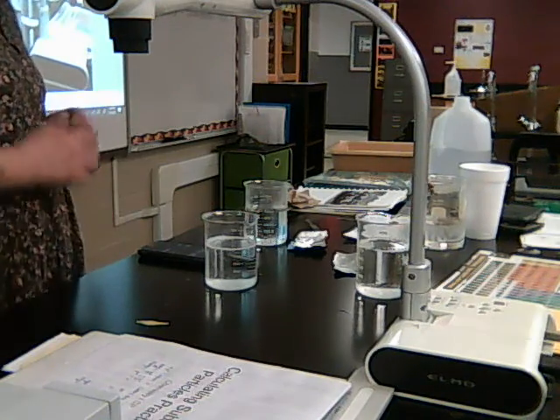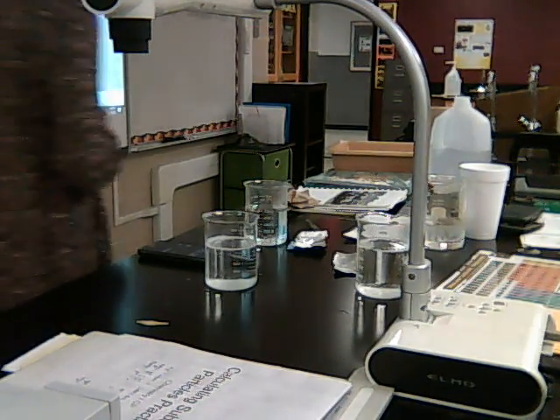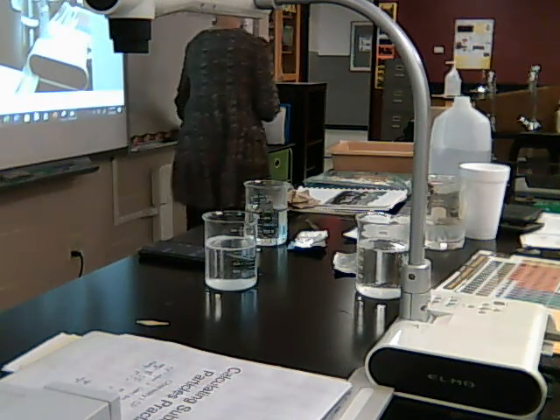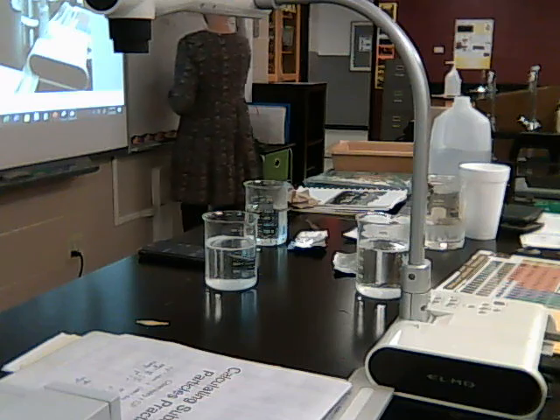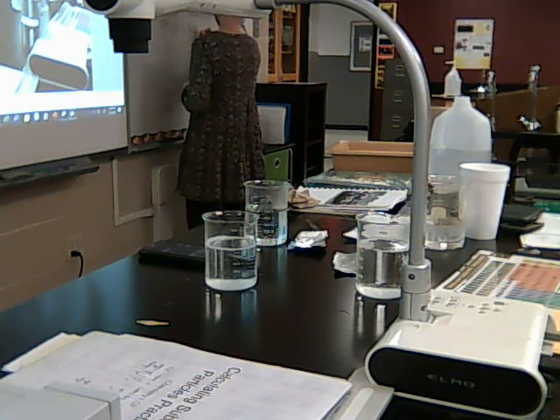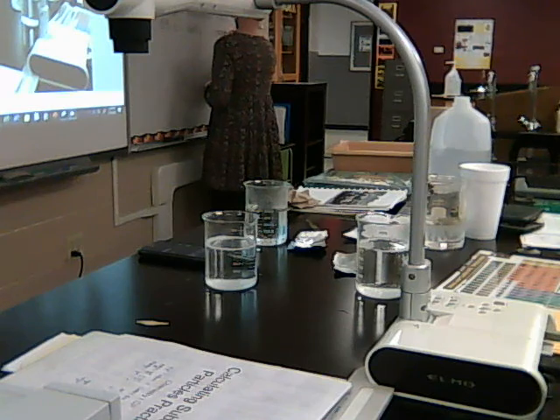Okay. So I've got 59 seconds. I'm going to write that over here too, so we don't have to try to memorize it. And this was the halves, in the room temperature water.